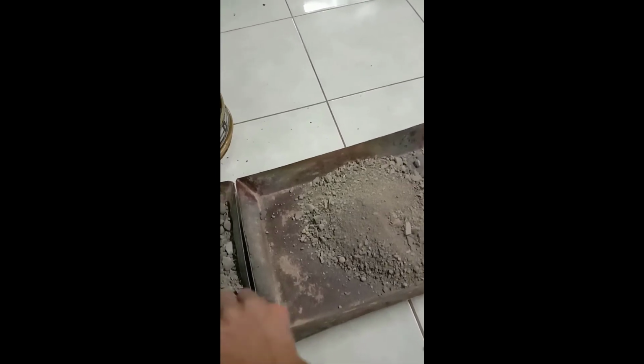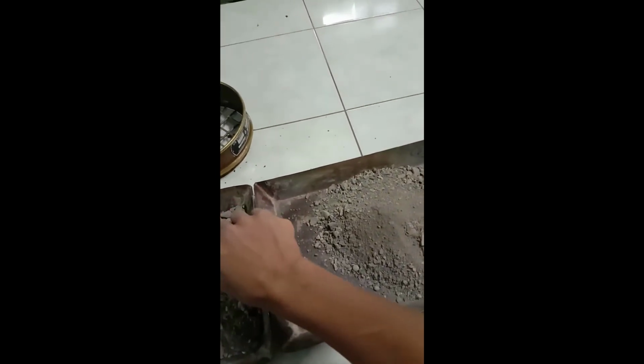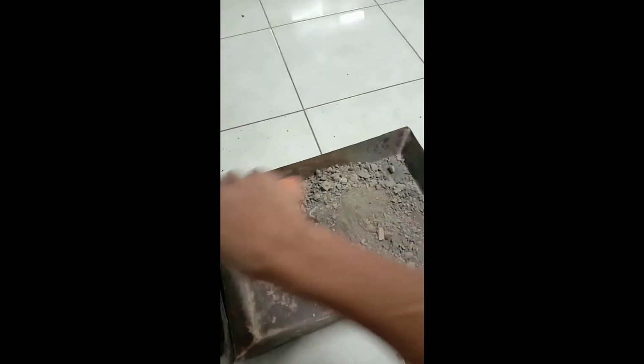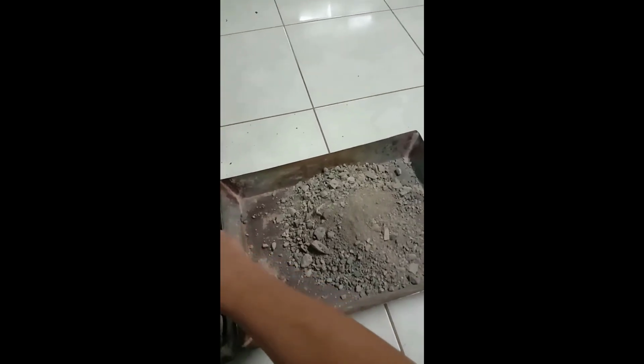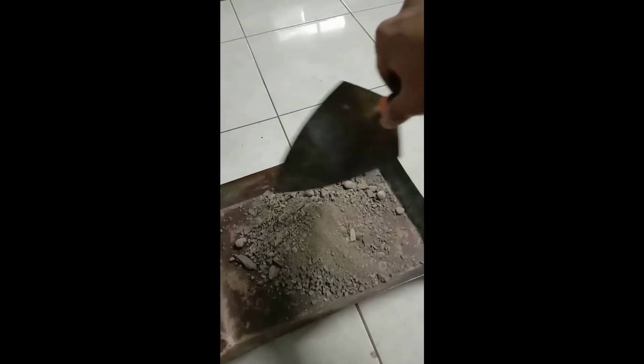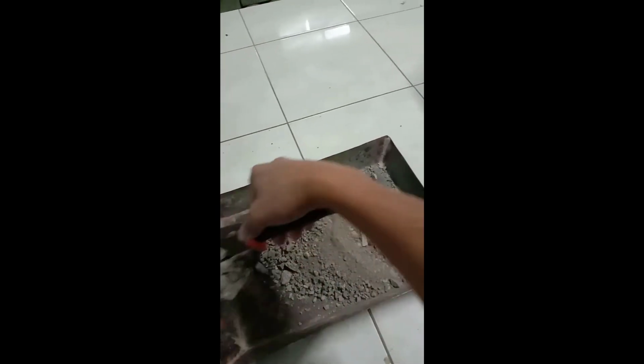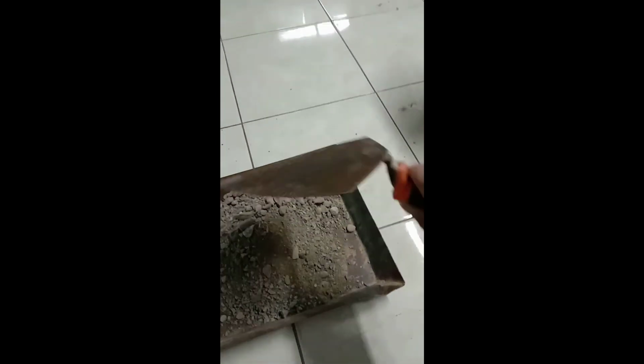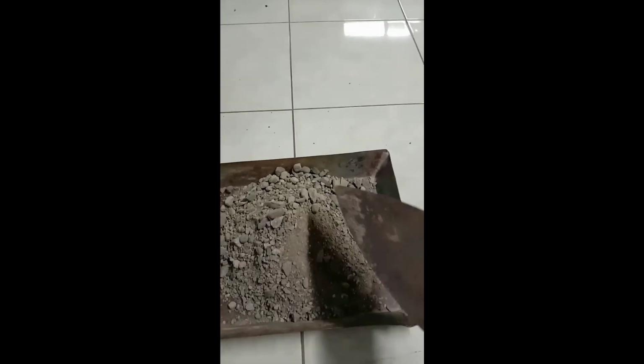By the way, it is stated there that the sample should be free of moisture, so it means that it should be dried, and your sample should be free of silt or sand or soil. Again, that is discussed in your lecture. So let's say that is just the small scale of the sample. If you are considering a bigger scale, then you will have a lot of this. So first is to put it in the form of a cone. What is the reason why we are putting this in the form of a cone? So that once you drop the sample, it will be distributed all around, so that the distribution will be equal.